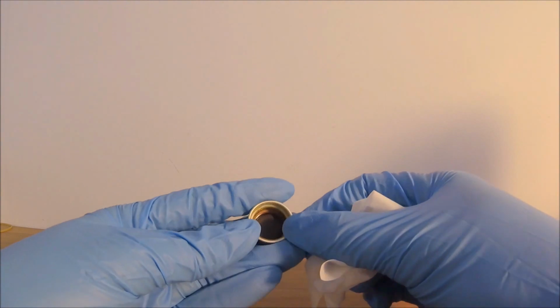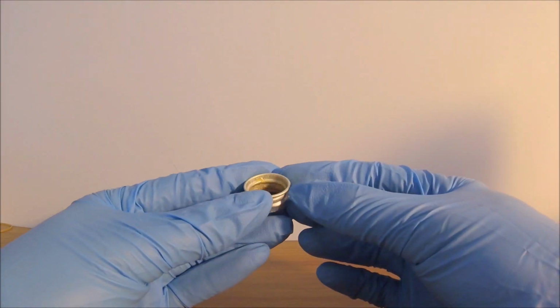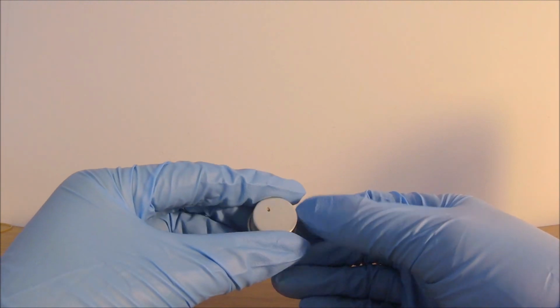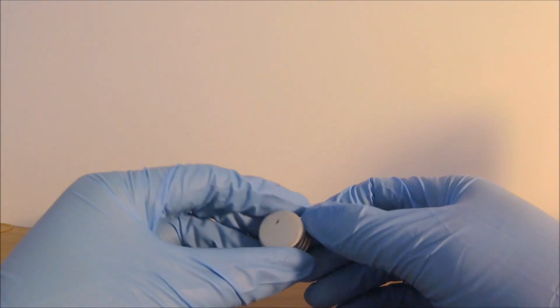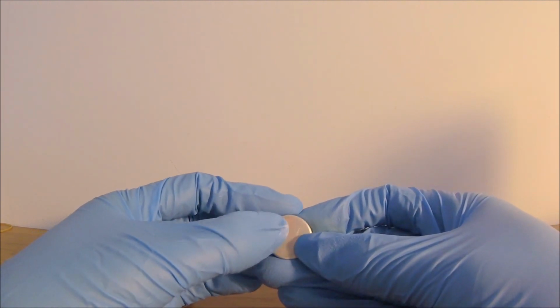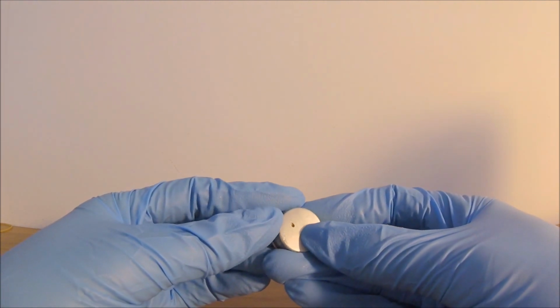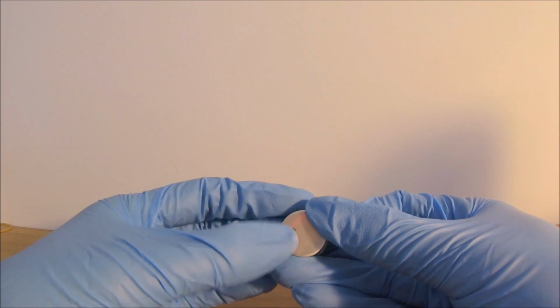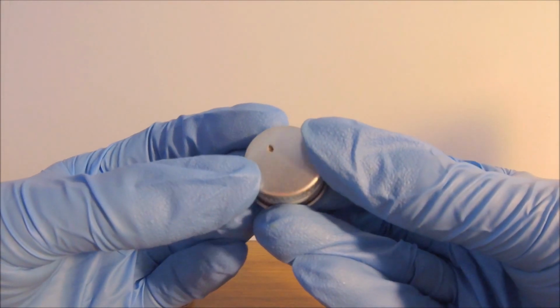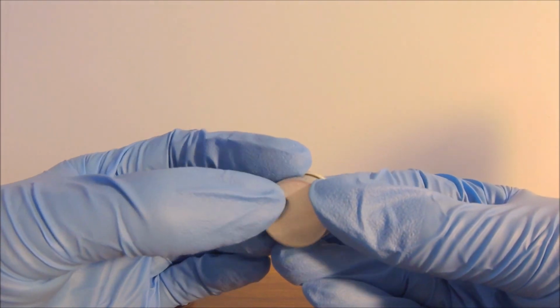Okay, let's look back to the cap. This cap is made of aluminum and has an organic polymer liner to keep it watertight. Wait a second. Something doesn't feel right here. This black mark here does not feel like some sort of dirt that's stuck on it. I have a very bad feeling about it.